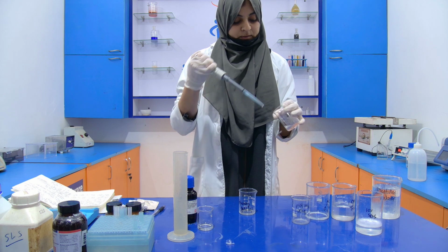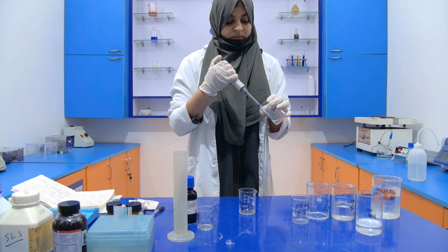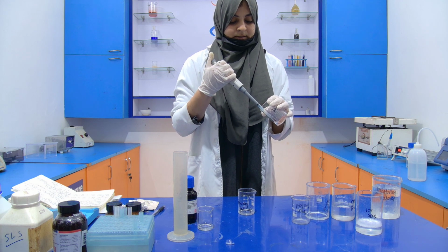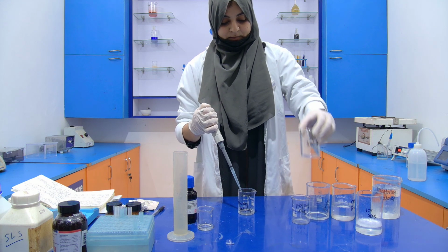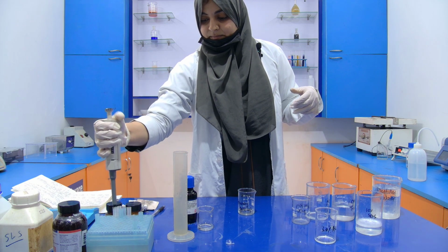1, 2, 3, and the last one is your 4. Then after that, we are going to add our SDS.